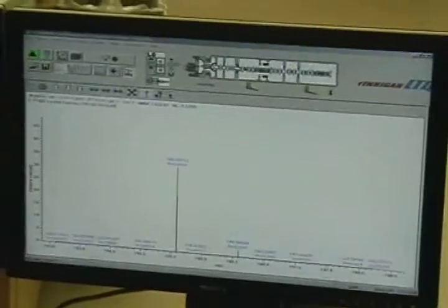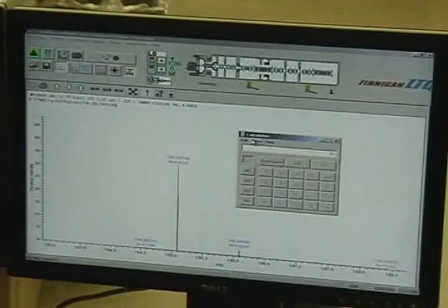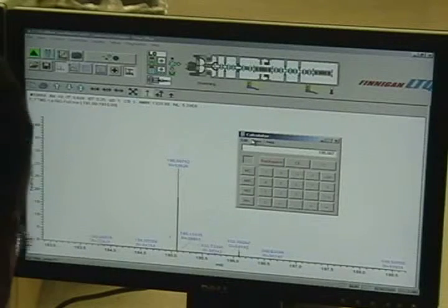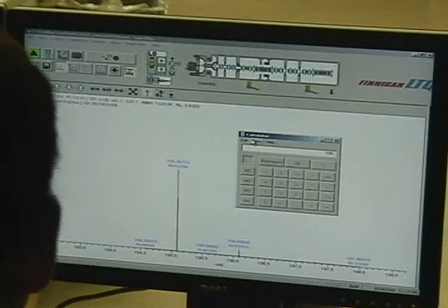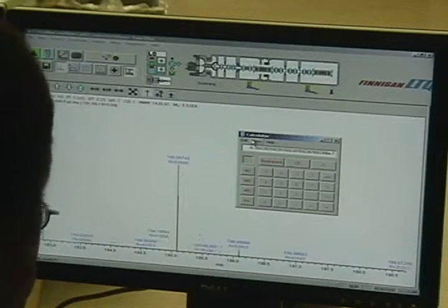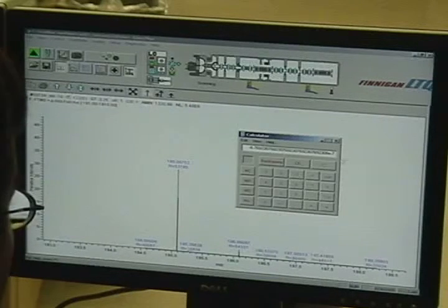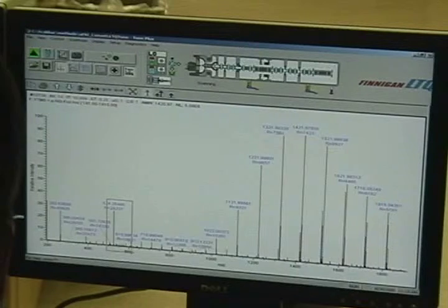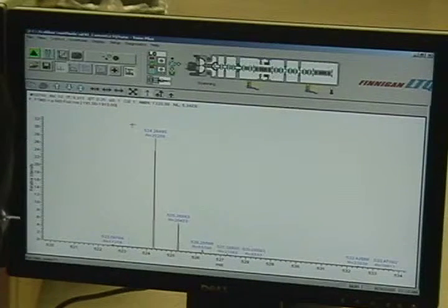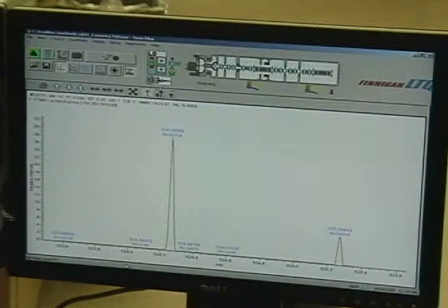I might have dumped the calc, I think. Divided by 195. So we're 0.7 ppm for the caffeine. So you've set it at 25,000 res. Yeah, the res won't affect your mass accuracy.